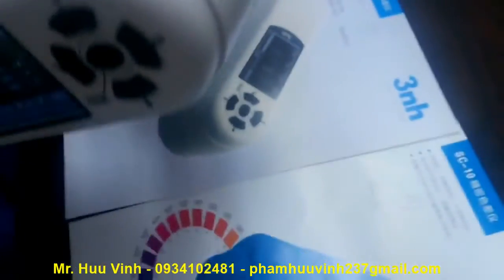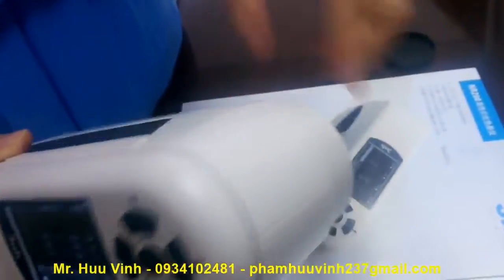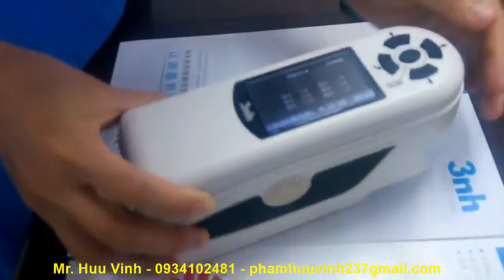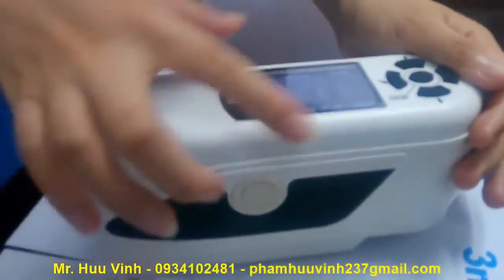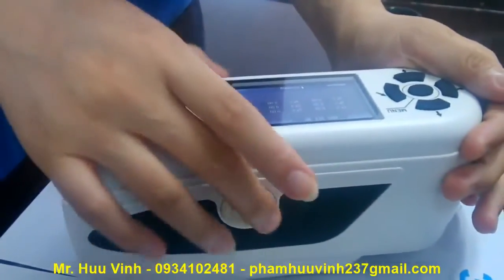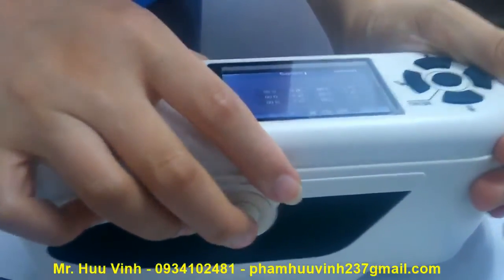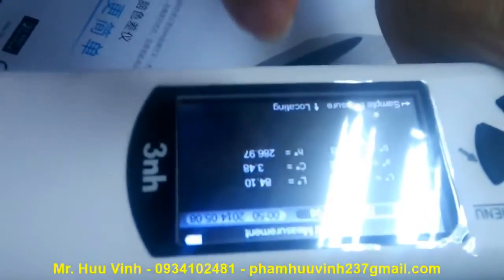Now put off the cover and close the aperture to the product. Then we start to measure these products. Press the test button — when we press the test button, we will hear a click sound, and the data is no longer zero.